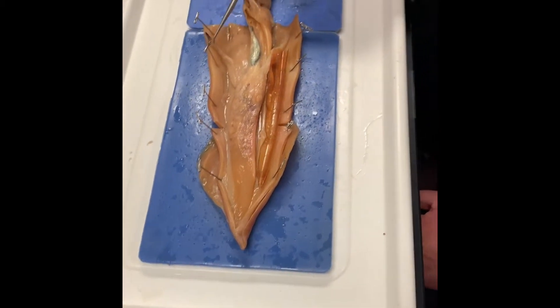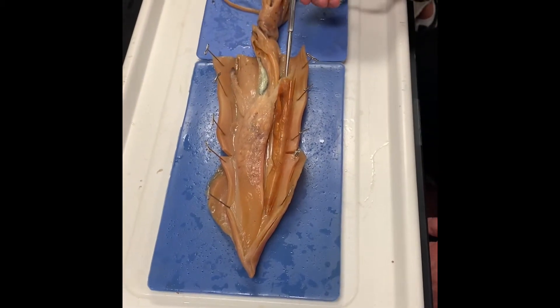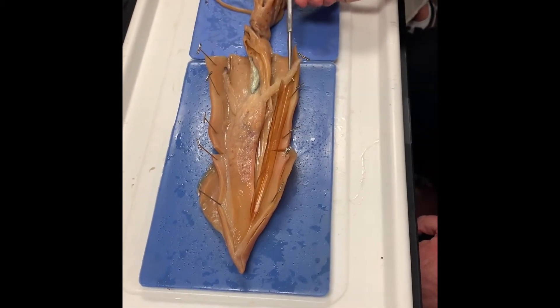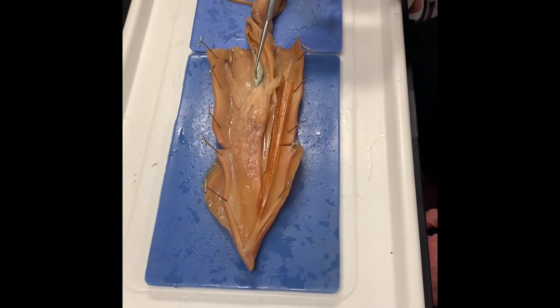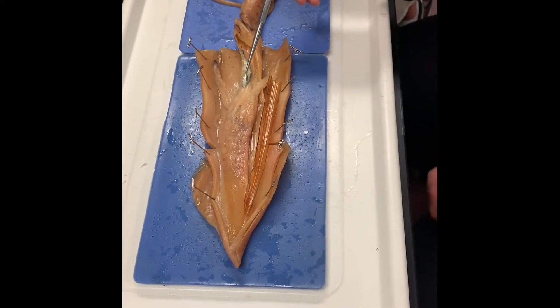The gills stick off to the side — there's one gill here and the other gill here. The ink sac kind of looks like the gills but runs down the middle, and it's got this darker, obvious inky appearance. That's the ink sac.